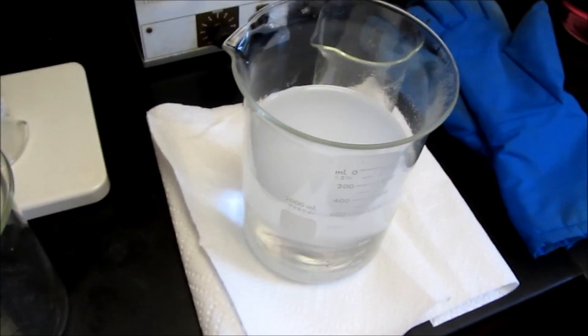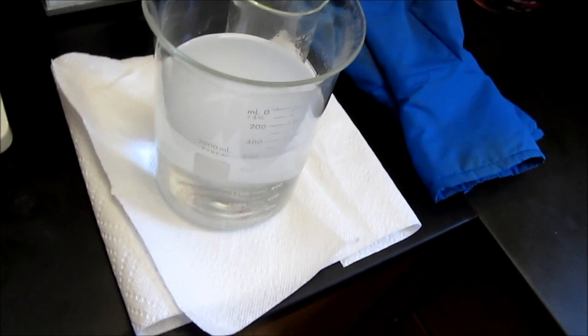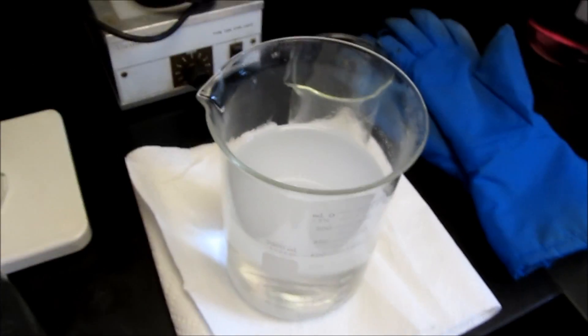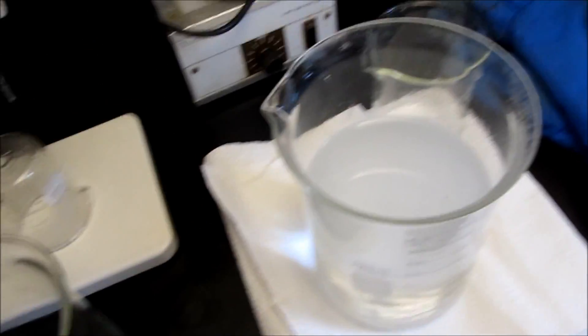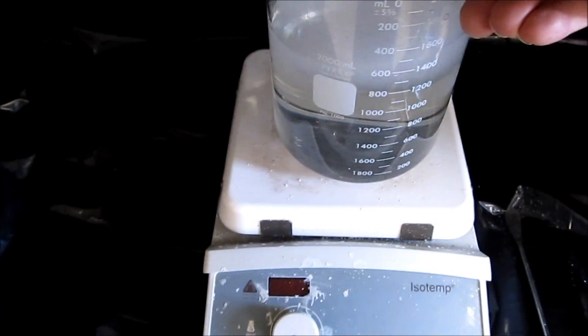Then the batteries die and you have to change the batteries to keep continuing what you're doing here. Anyway, got the water and the sodium hydroxide mixed together. Put that on my hot plate.